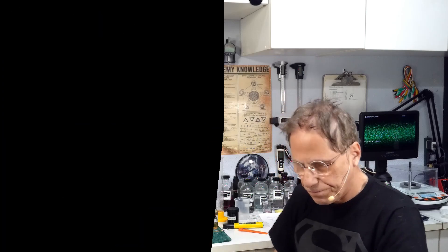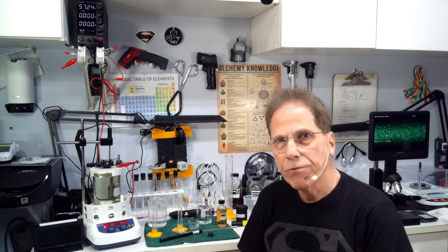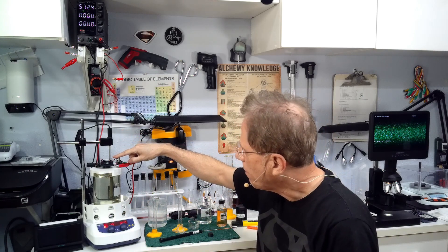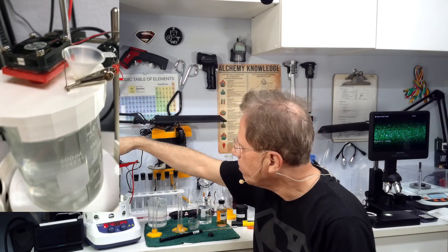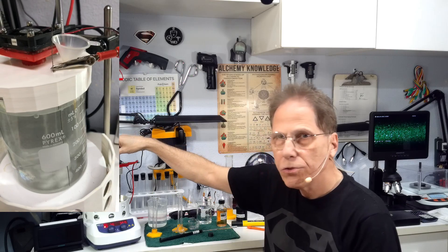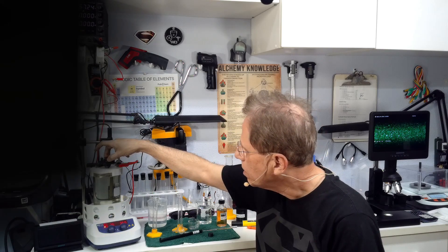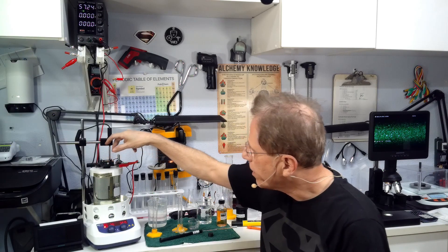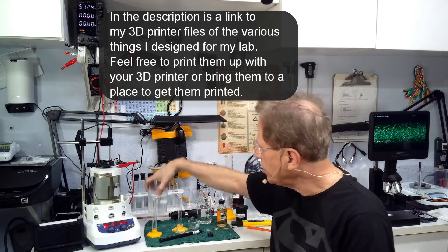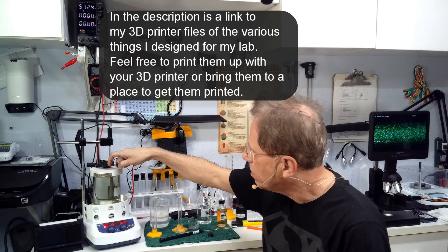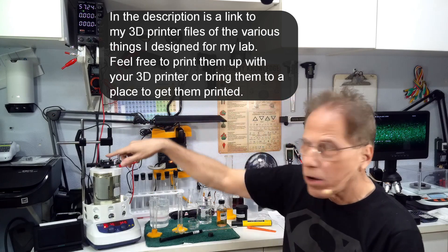Welcome back, I'm at 76 degrees C and we're ready to start the process. I've put my platinum rods in here and I've hooked the power supply up. I got my fan in here which removes the excess heat, which cuts down on the amount of evaporation and maintains a nice temperature so I don't crack my tops here.